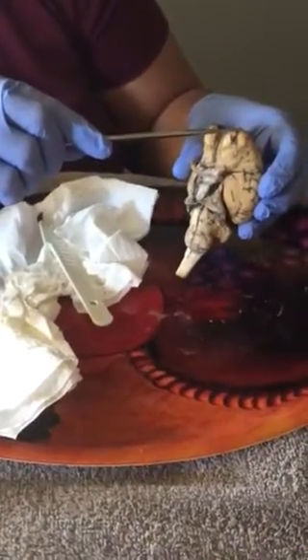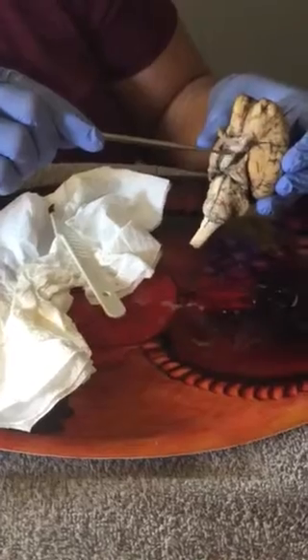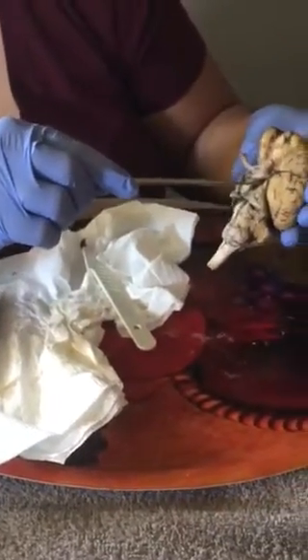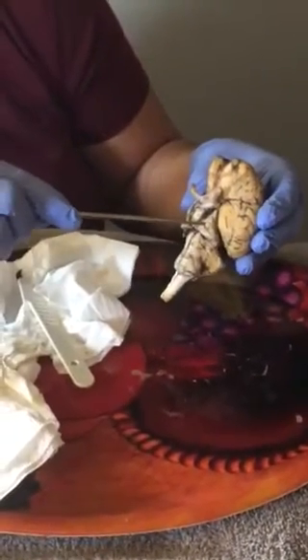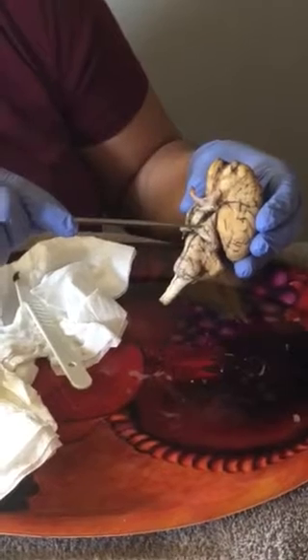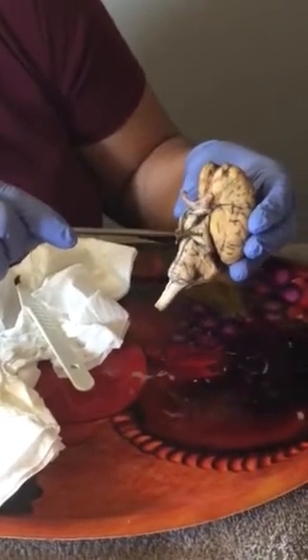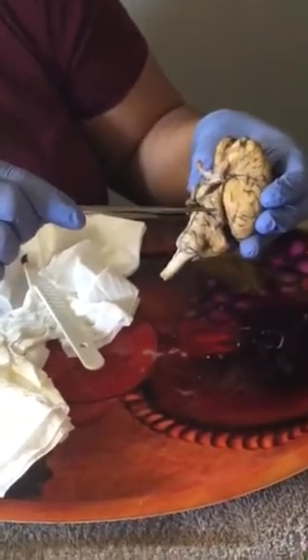And then next we have the optic. And then on these parts right here, we have the oculomotor. Coming up from the side, we have the trigeminal. Right under that, we have the facial. Under the facial, we have the glossopharyngeal. And then all the way down here at the bottom, we have the vagus.